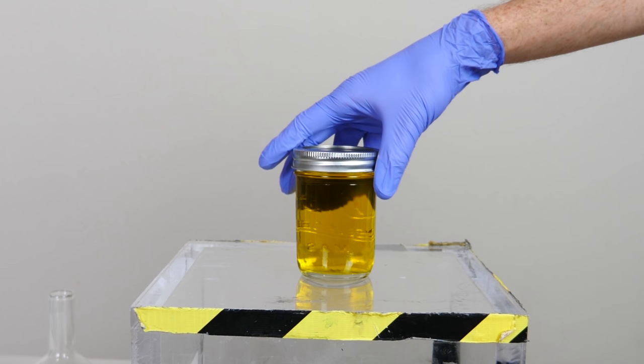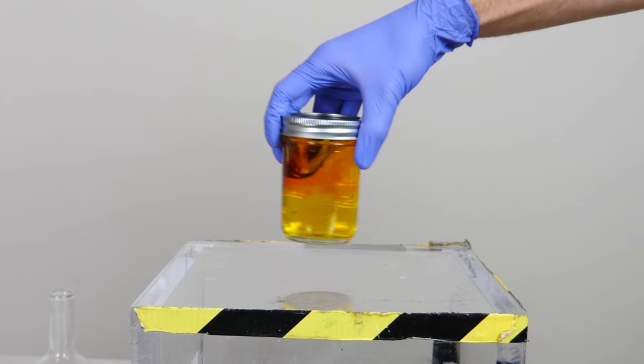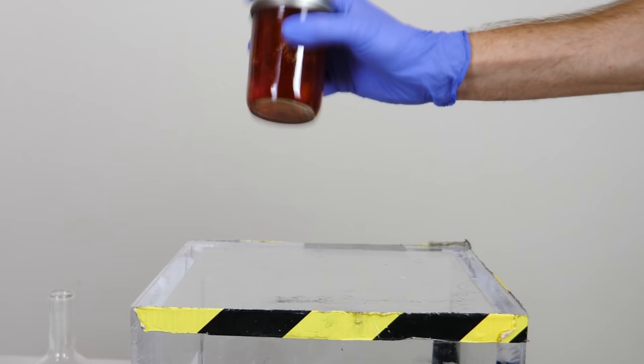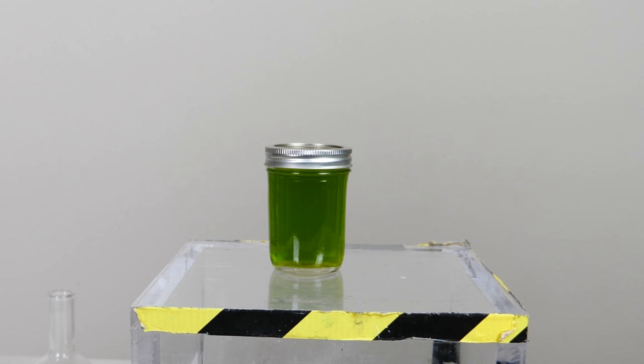We have a yellow liquid, but now let's turn it red. Now let's make it green. There we go, that's awesome.